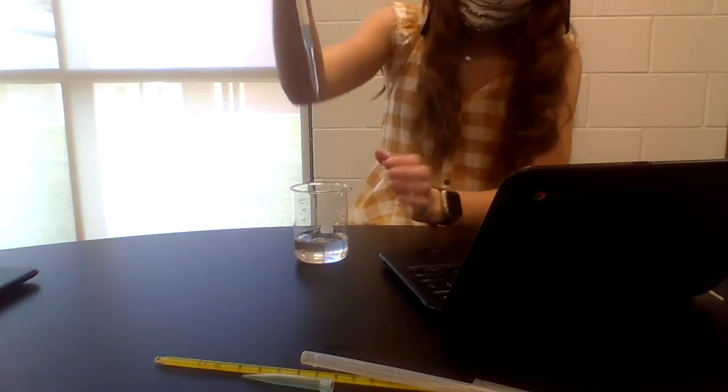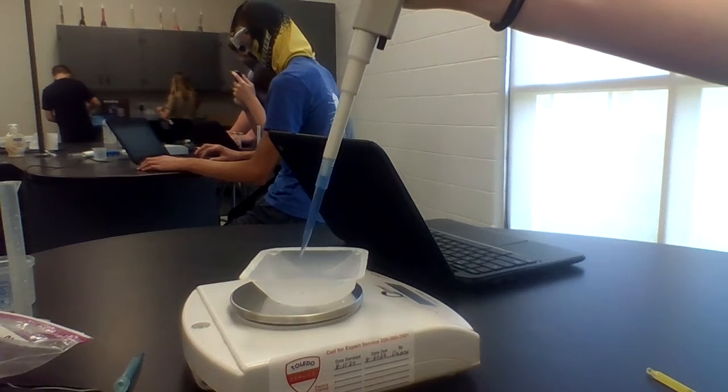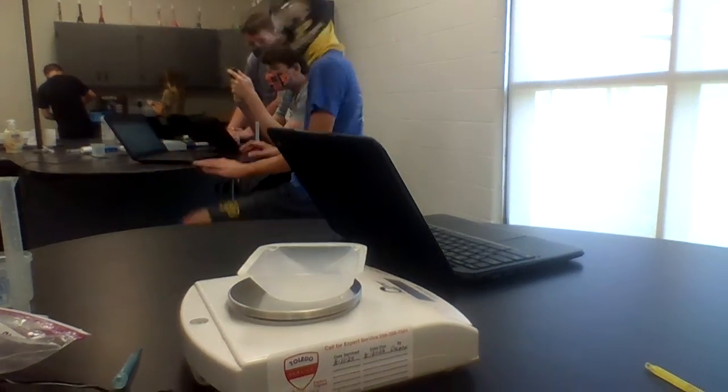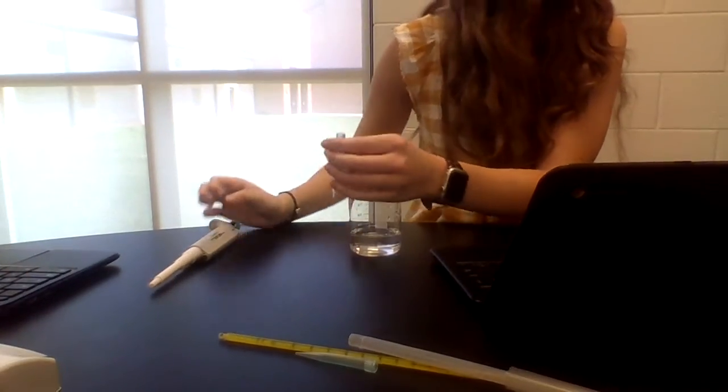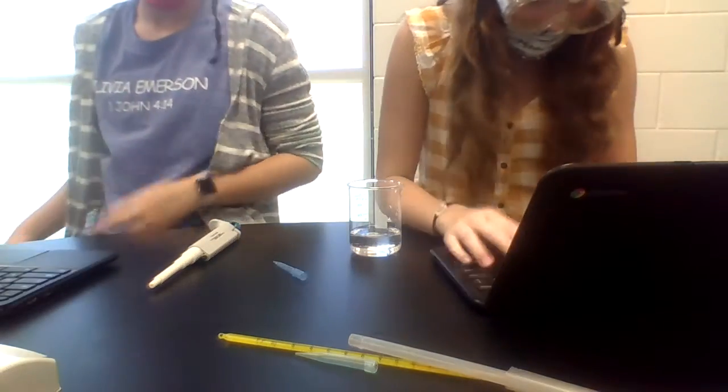Alright, back in there. Now, math wise, it might be different. Now don't set that down with the tip on it. Don't do that either. Straight up. No, no, there you go. Just take it off.